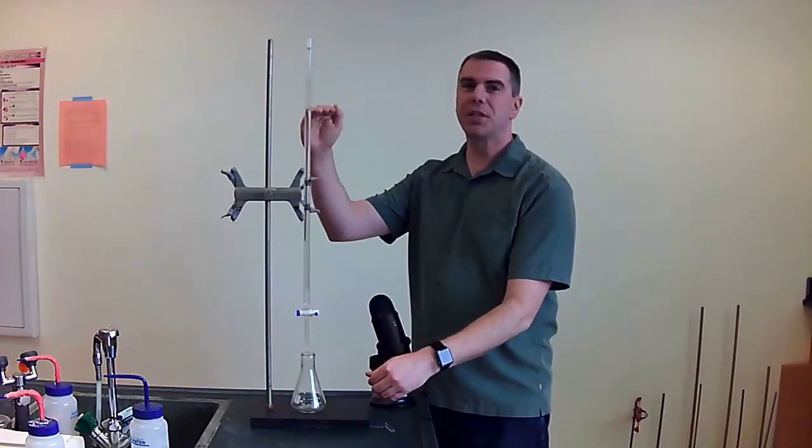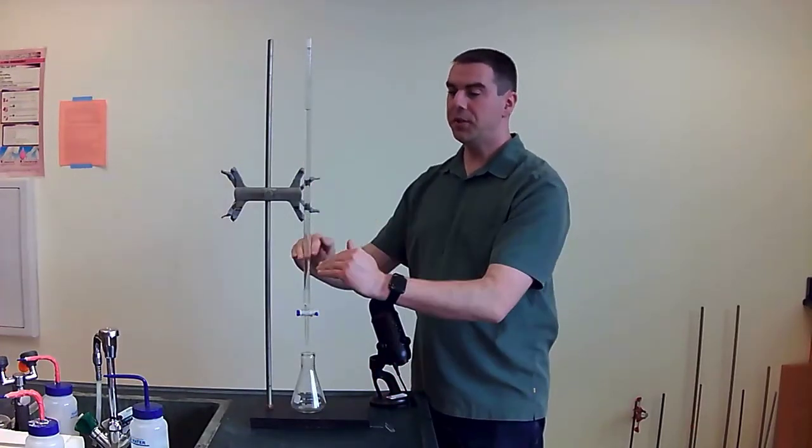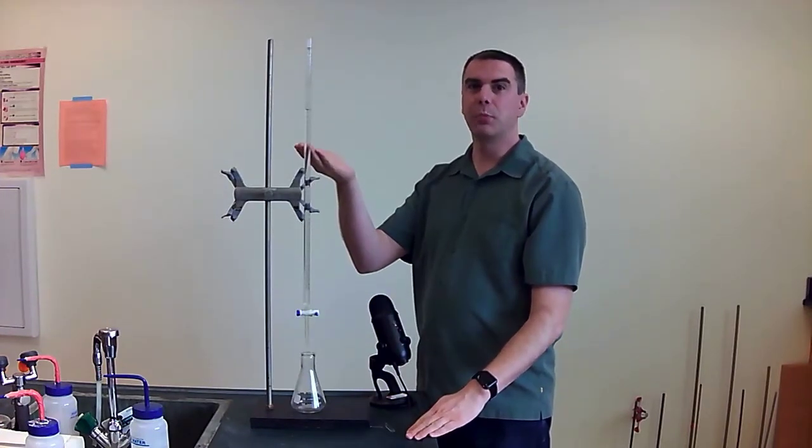We want to precisely know where the level of liquid in this burette starts and where it finishes. For example, here's the starting measurement. I'll zoom in on it for you.